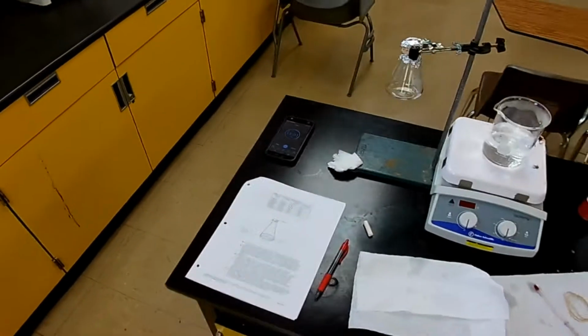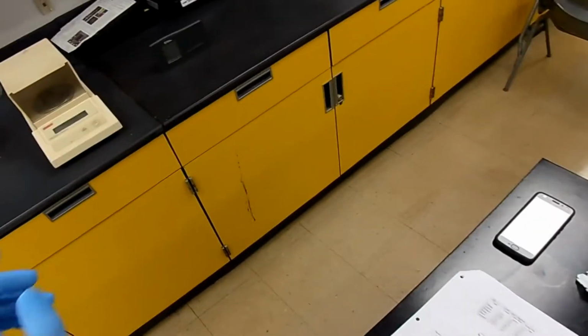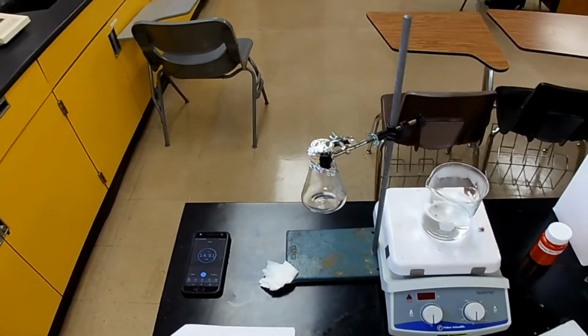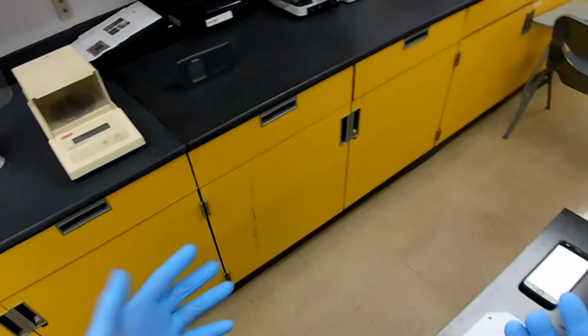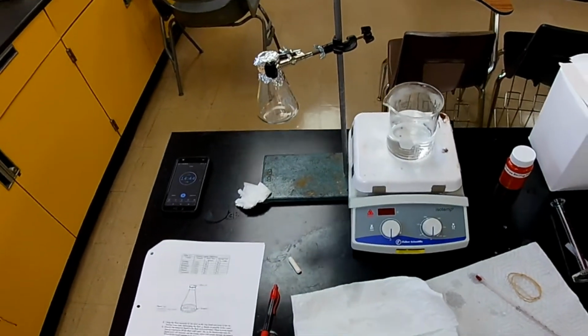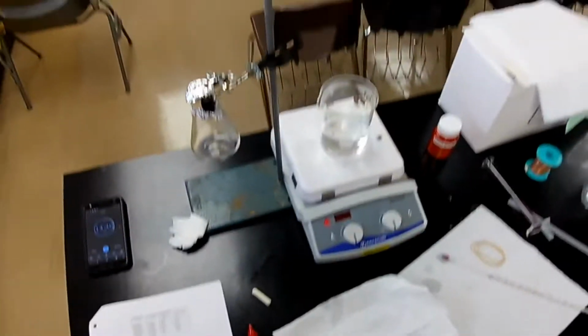But this thing has to be room temperature before we can measure the weight. Because if we put a hot piece of glassware on the balance, it will never settle down. It's very sensitive to temperature, and it'll create drafts, and it'll transfer heat to the balance and the load cell, and it's just a mess. So it has to be room temperature. We'll let that go for now.